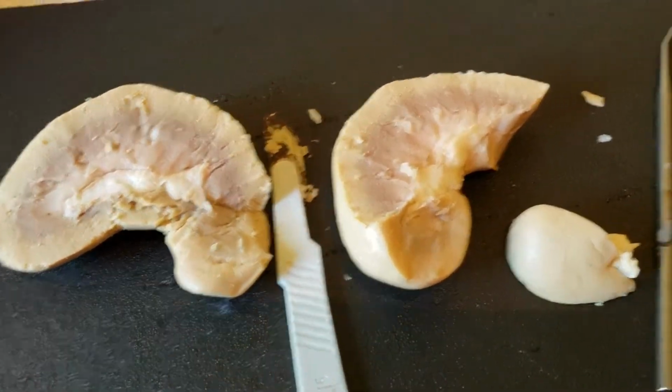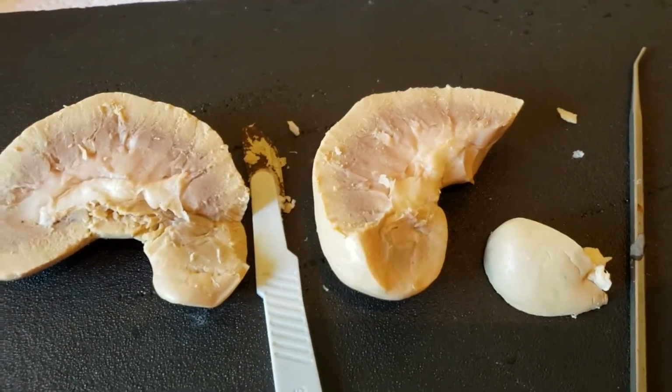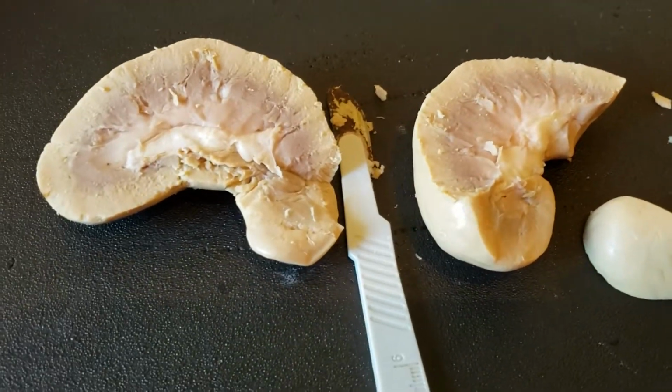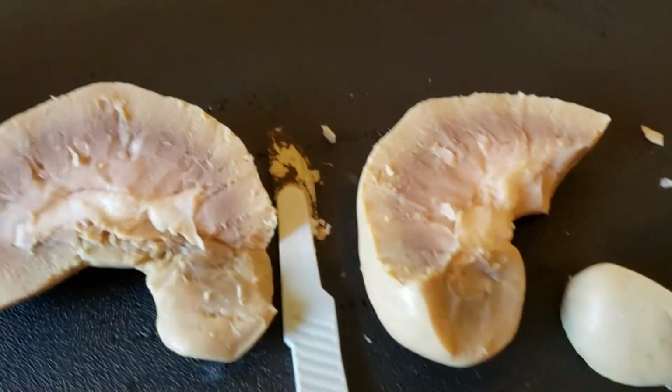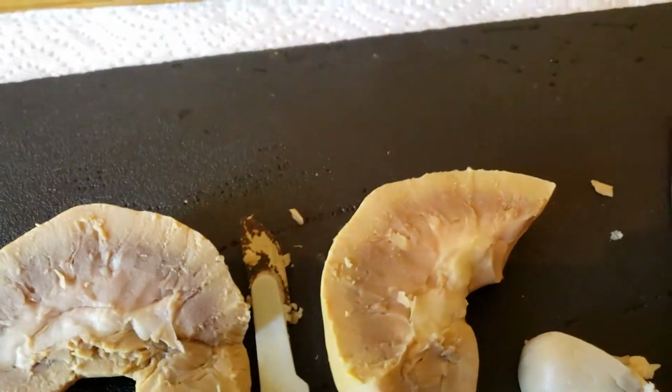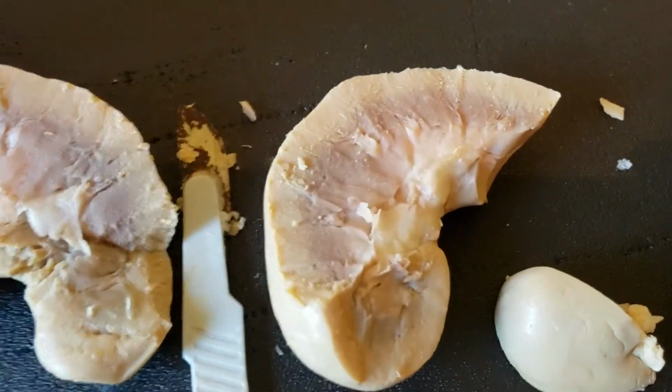So this dissection wasn't really, well, actually it kind of was a dissection in the purest sense of the word, splitting it into two pieces. I'm going to stop talking now and just get into the dissection. I just realized that it was a literal dissection, so that's pretty cool.